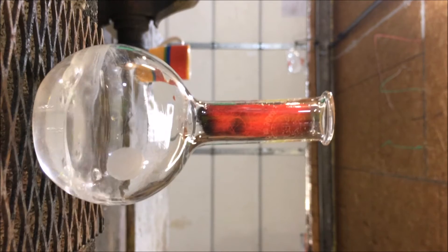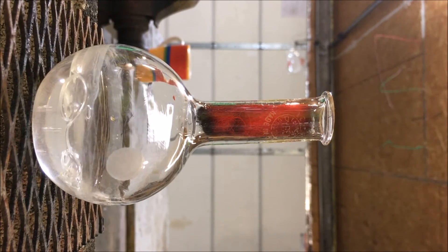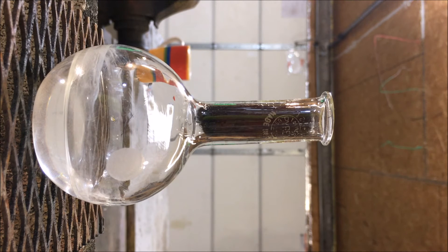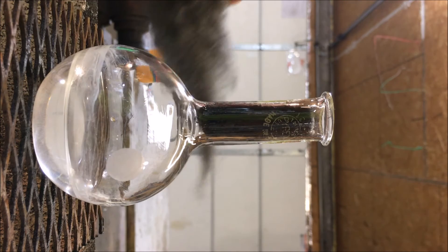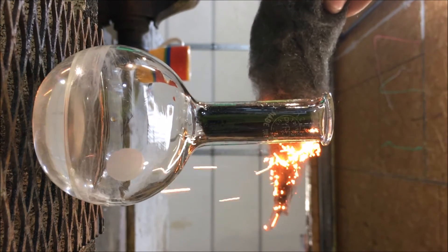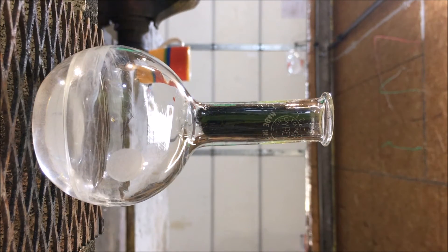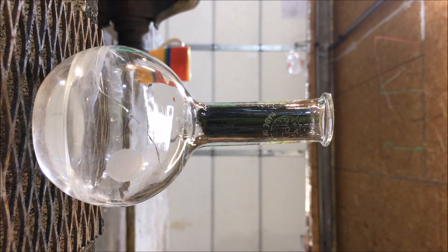No observable hydrogen production took place there. Some of the little experiments shown in old chemistry books showed a similar apparatus producing a small amount of hydrogen gas that should have produced about a match-size flame. This setup isn't quite properly rigged for that. One of the problems is that the steel wool used here is not like the old steel wool — this newer stuff does burn, but it doesn't quite burn like the old stuff did. It burns pretty hot but leaves a lot more grey mass left over, as if it's some kind of cheap metal alloy. So that could be part of the problem — my iron catalyst may have just failed, and it may not have been big enough for the amount of steam being generated.